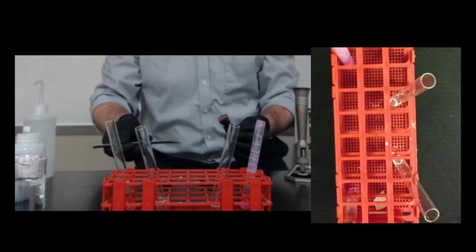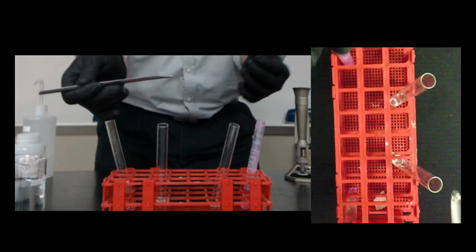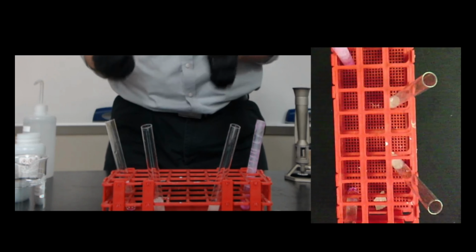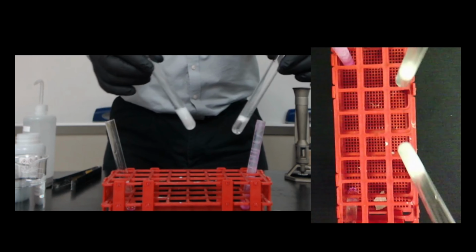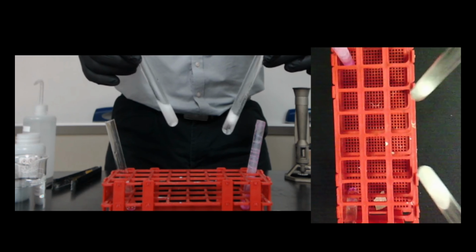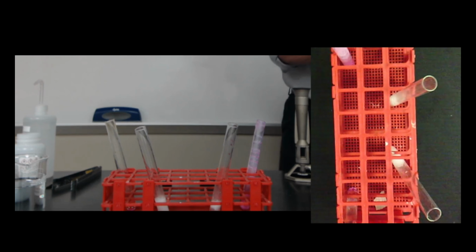All right, so I've got my calcium over here and my magnesium over here. So let's go ahead and put them in. So 1, 2, 3. Okay, again, production of gas, you can see the bubbles. Okay, now while that's going, I'm going to get my flame test ready. Turn on my burner so we can verify that this is indeed hydrogen gas that we're making.